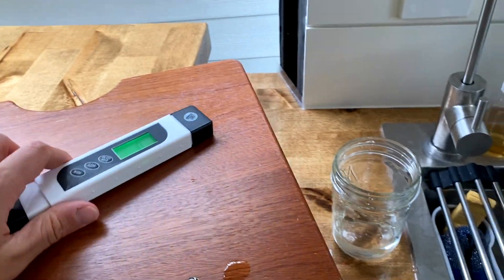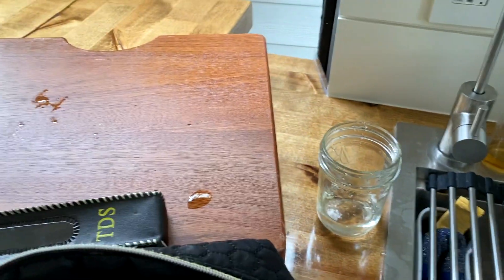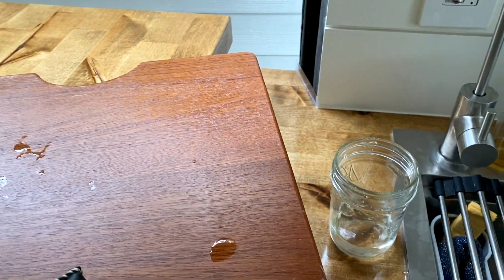So 264. We at one point filled up with really hard water from like a well, had lots of minerals. So that's why I think a mixture of that water and this water is showing a higher value on the TDS meter.